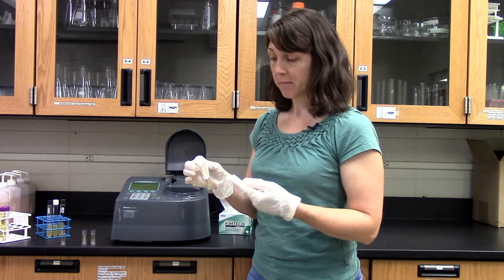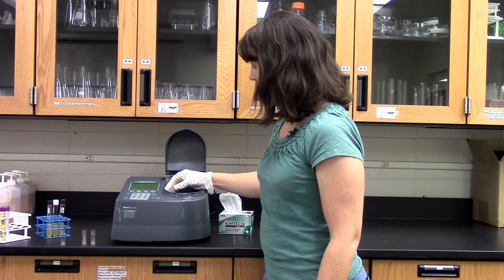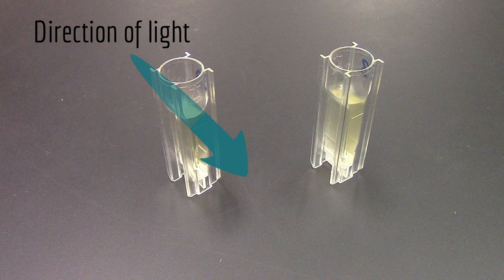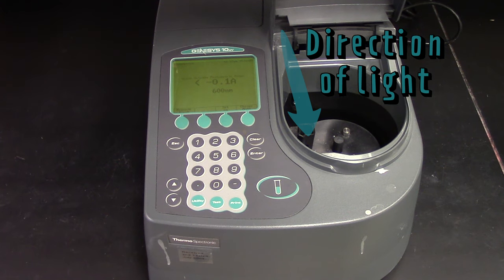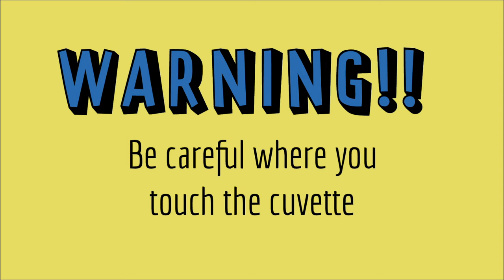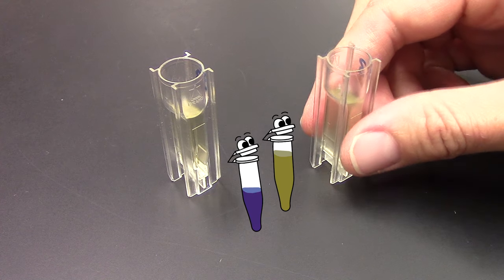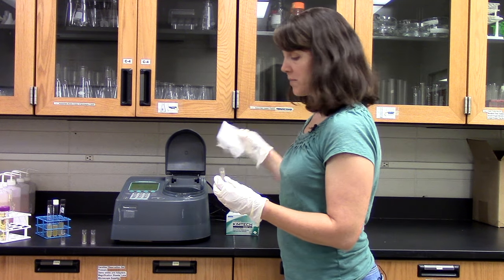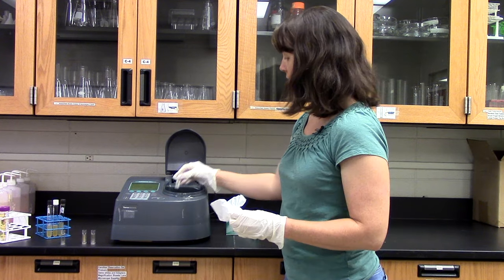Measuring the sample is pretty easy. Pipette it into the cuvette, insert the cuvette into the spectrophotometer, and close the lid. Note that the cuvette is designed for light waves to pass through it in a specific direction — make sure you orient it so the light beam goes through it the right way. Don't touch the part of the cuvette that the light goes through, because your fingerprints can interfere with the absorbance reading. It's good practice to wipe the cuvette to remove any potential fingerprints or dust before putting it into the spectrophotometer.